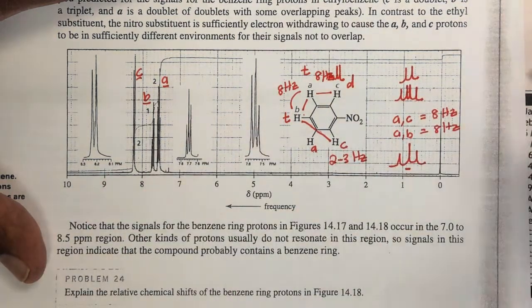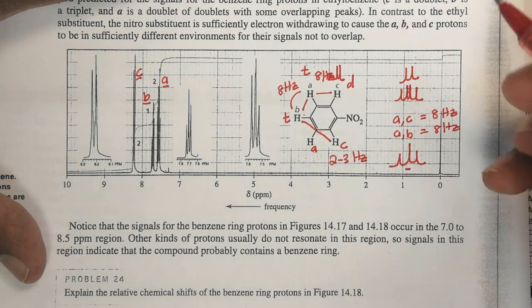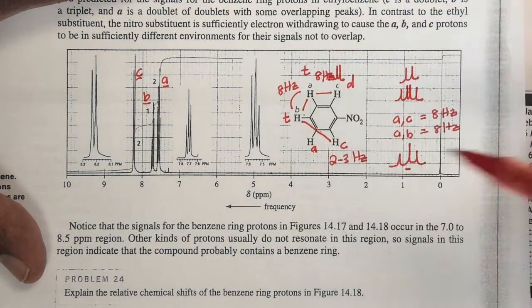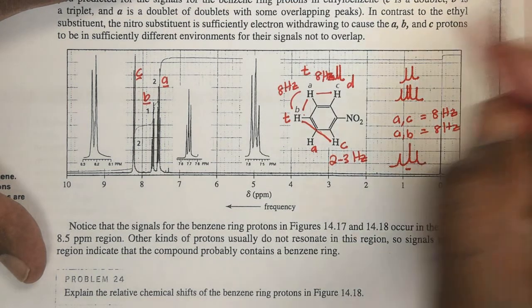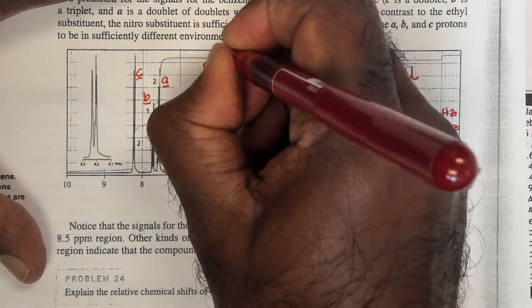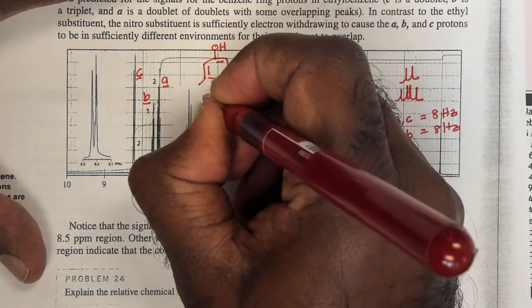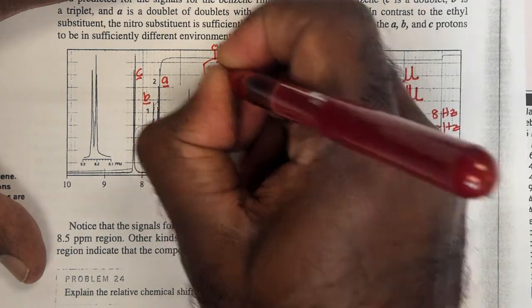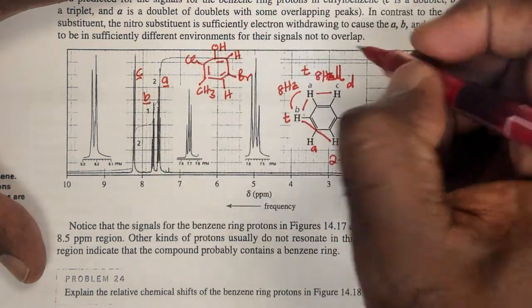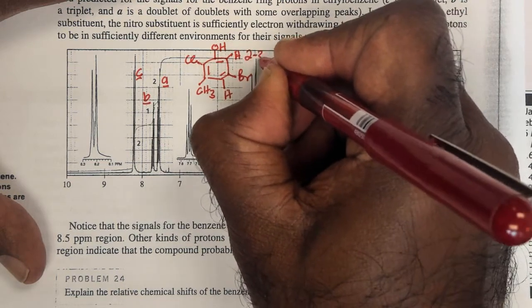Right, so you don't see it in this particular example because we have equivalent protons, but there might be other molecules where we can see it as doublets, and that would give you a very small coupling constant of about 2 to 3 Hertz. Alright, particularly if I have a molecule something like this. So if I had a group here, maybe OH, I can put another group here, maybe a methyl there, I'll put a chlorine there. So this hydrogen and this hydrogen each would be doublets with coupling constants of about 2 to 3 Hertz.